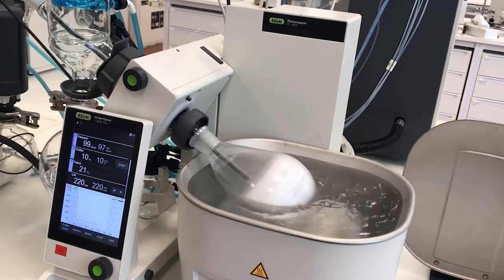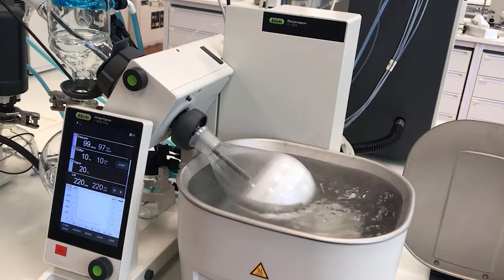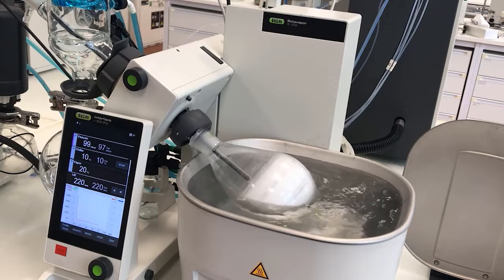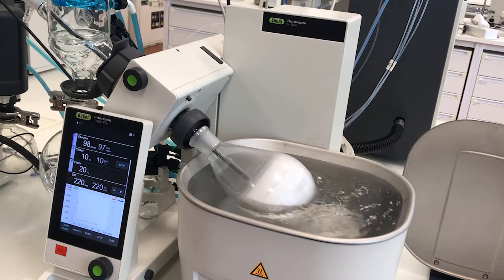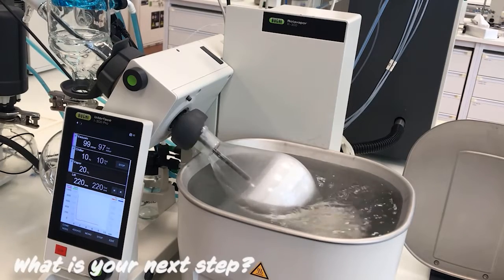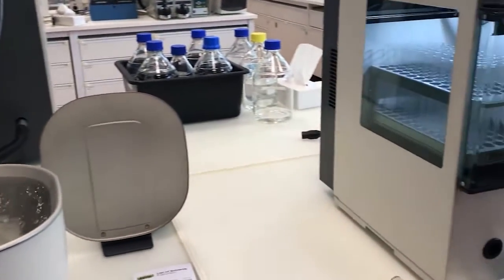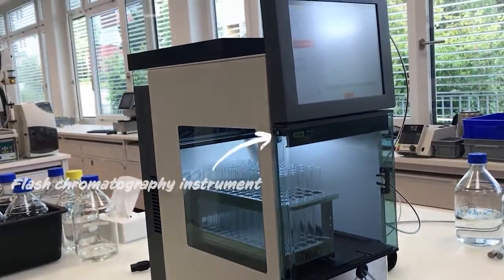If for your sample you need to concentrate — meaning you need to have some solvent left in the flask — then you'll have to stop the process before complete dryness. In order to decide whether you should go for concentration or drying, you need to know what your next step is. For example, if you need to perform a purification with a liquid injection of your sample into a chromatography system, then you would need to perform a concentration.